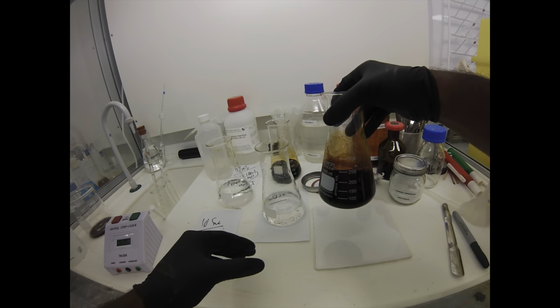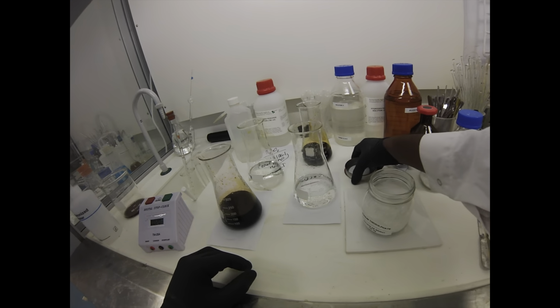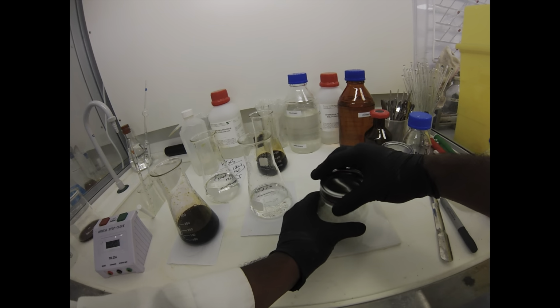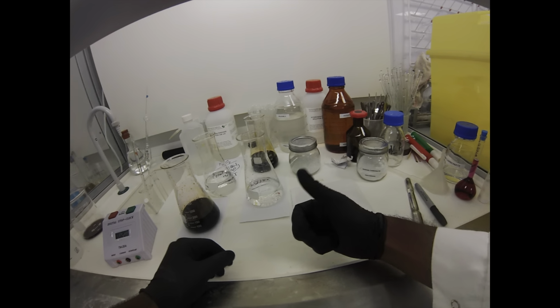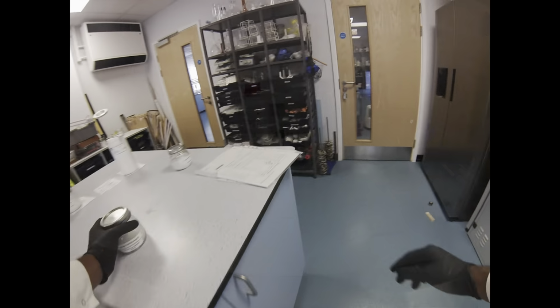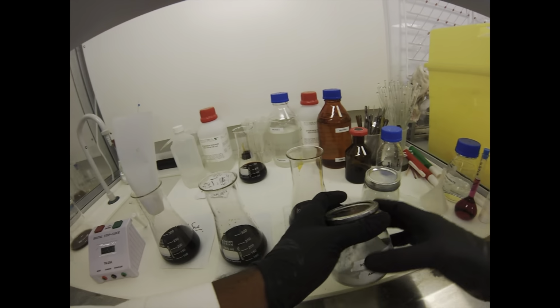The thiosulfate, as you add it, will take a while to dissolve. Once it's all dissolved, the solution will go back to being black. Then you have to add more, dissolve that down, let it go clear. Once that's dissolved and it goes black again, you keep doing that back and forth until it stays clear. Then it's good to go down with lots of water.